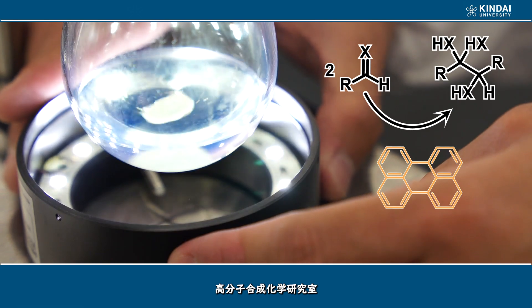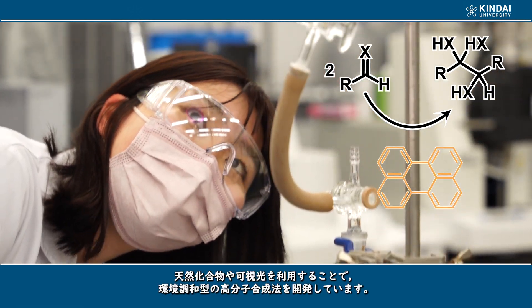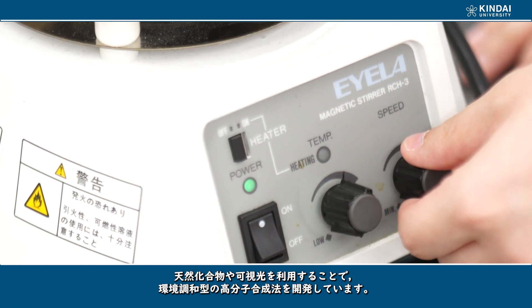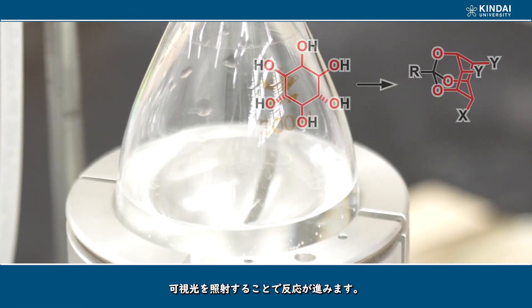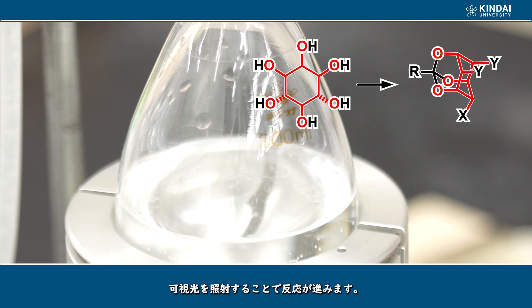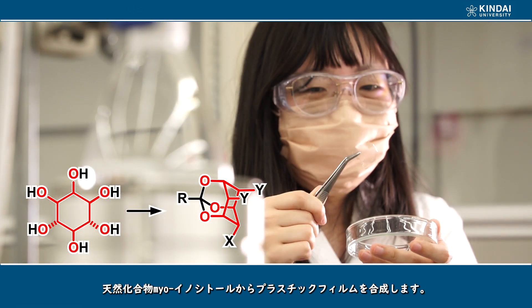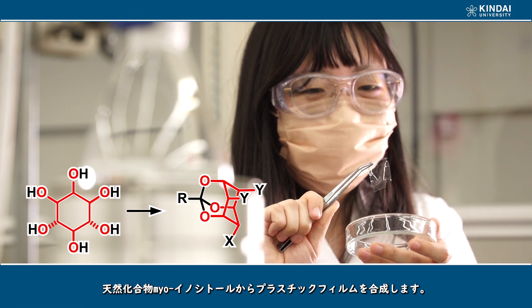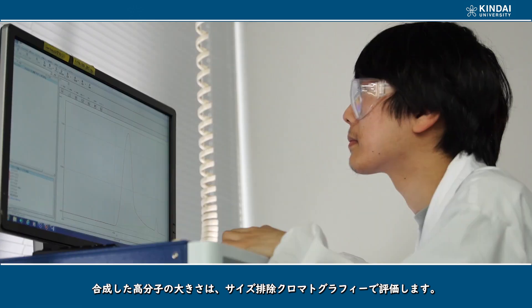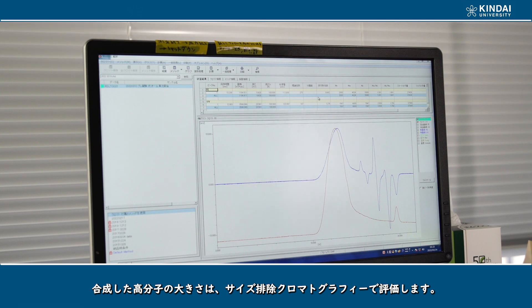This is the Laboratory of Polymer Synthesis. We are developing environmentally friendly synthesis of polymers using natural compounds under irradiation with visible light. Plastic films are synthesized from naturally occurring raw materials, and we evaluate the size of the synthesized macromolecules by size exclusion chromatography.